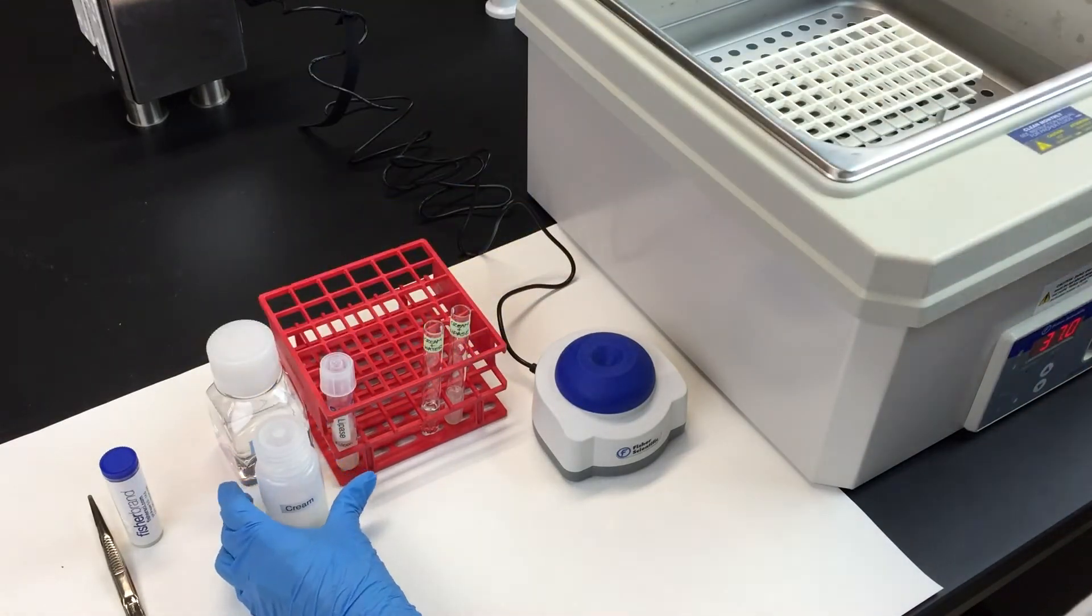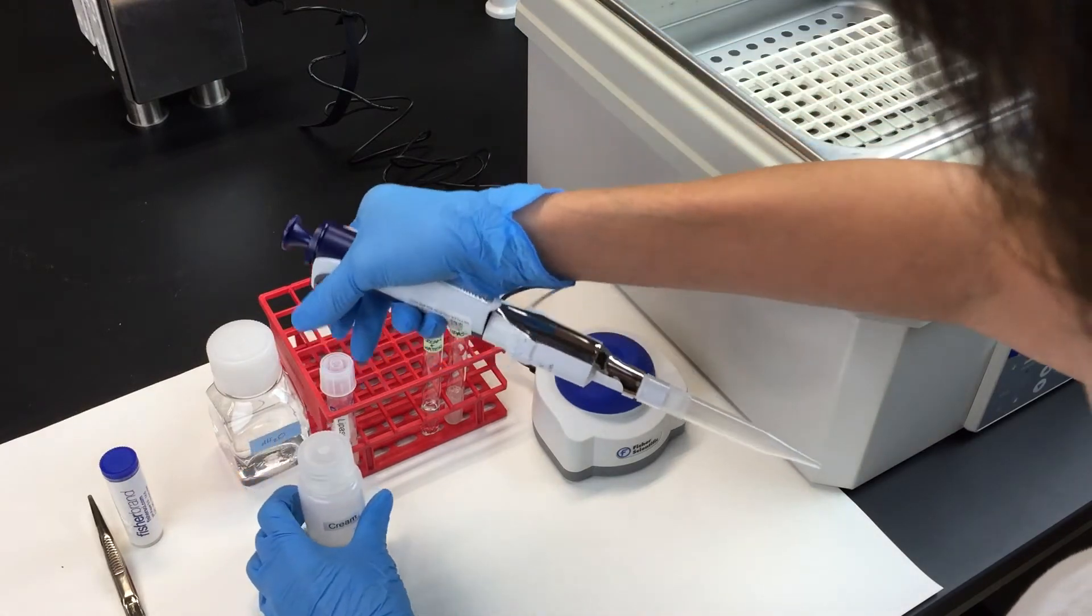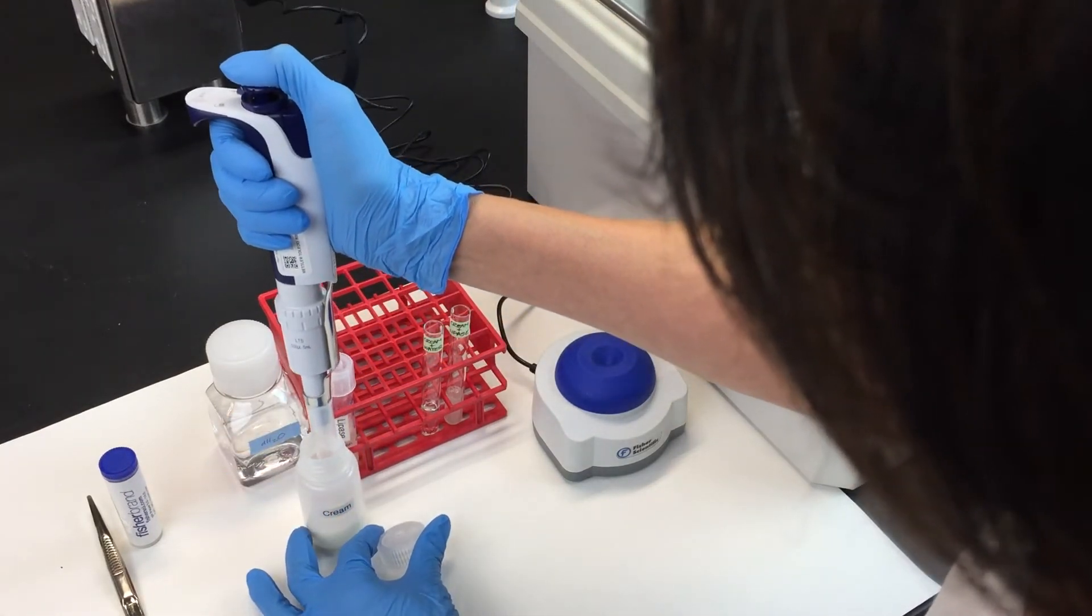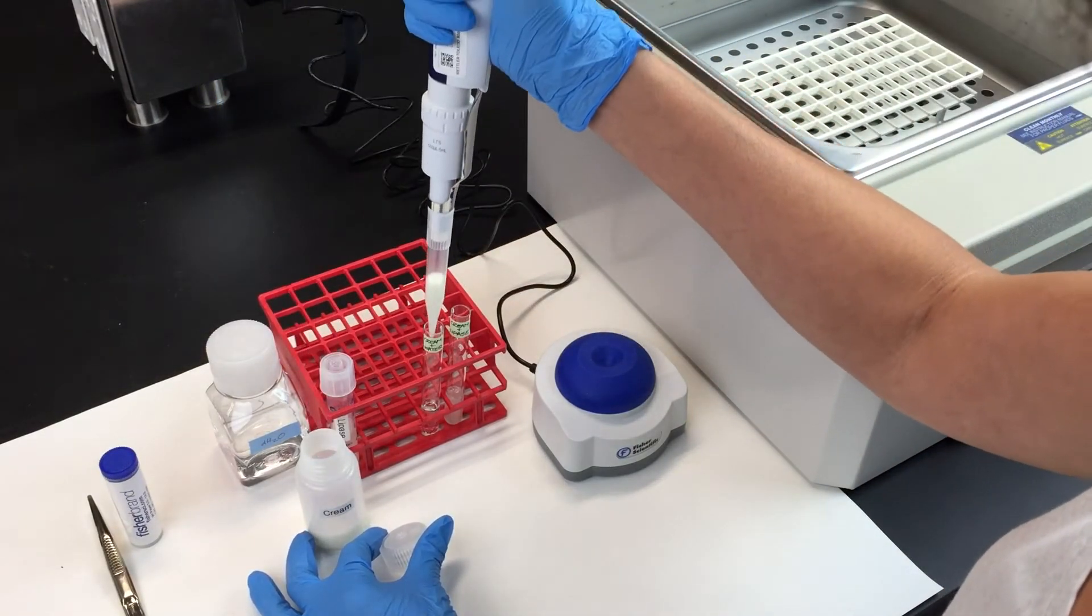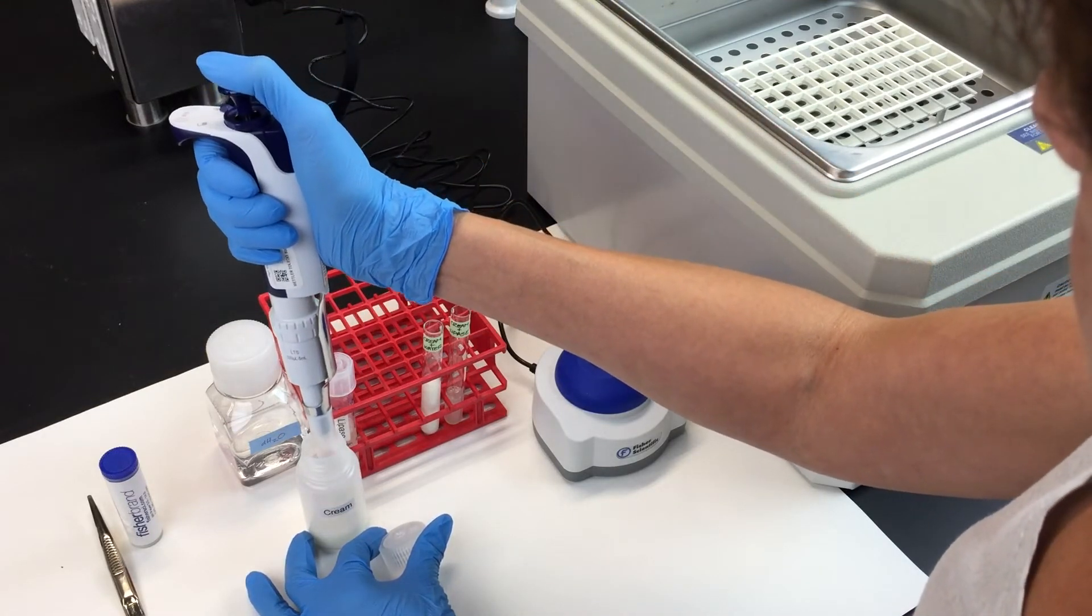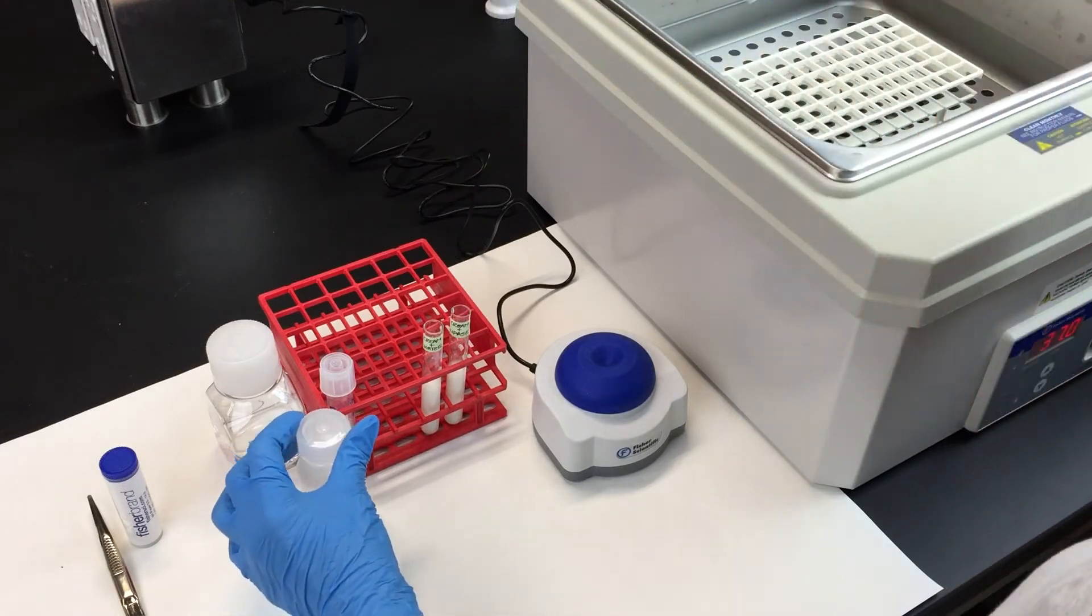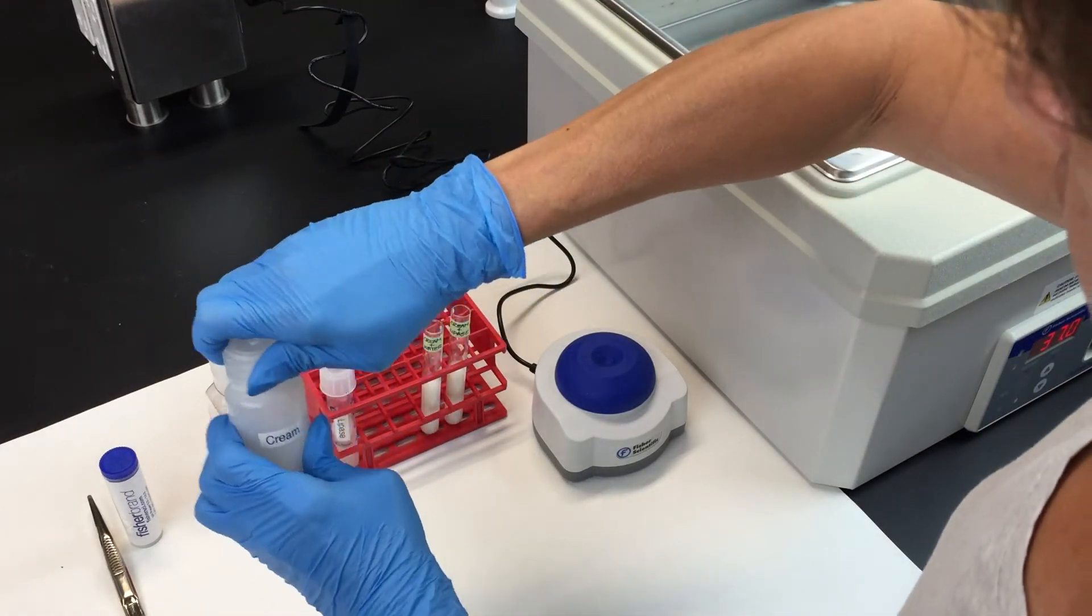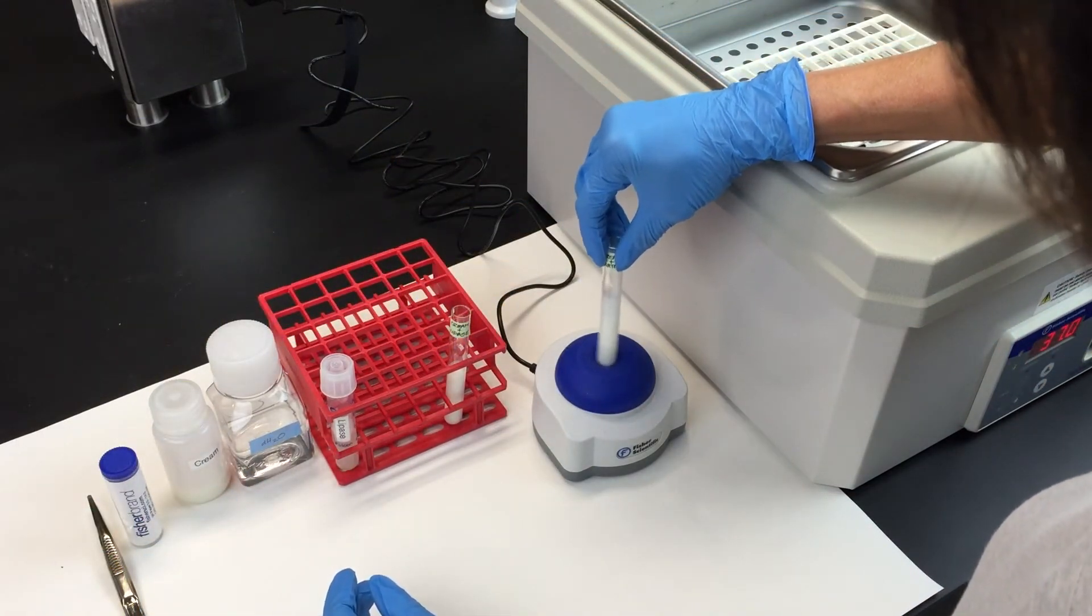Now add 2.5 milliliters of cream to both tubes. Give the tubes a quick mix.